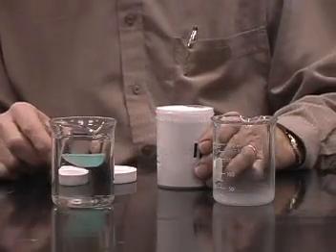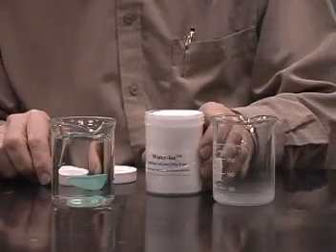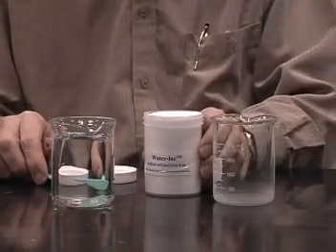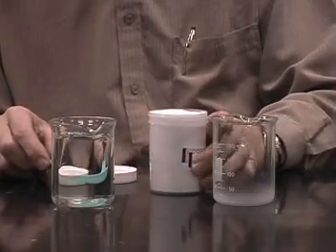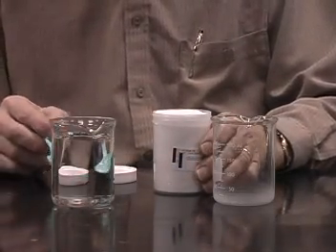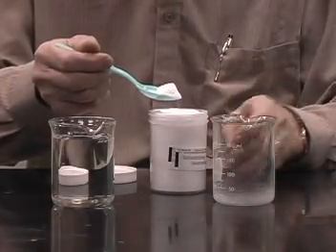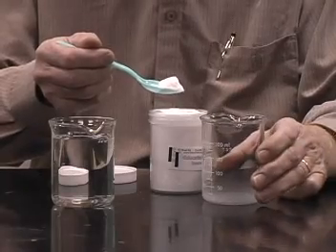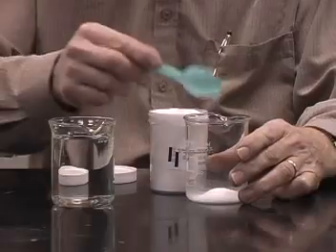An interesting polymer is one called water lock, which is in this container. It's actually sodium polyacrylate, and I'm going to take about two-thirds of a spoonful and put it into the beaker.